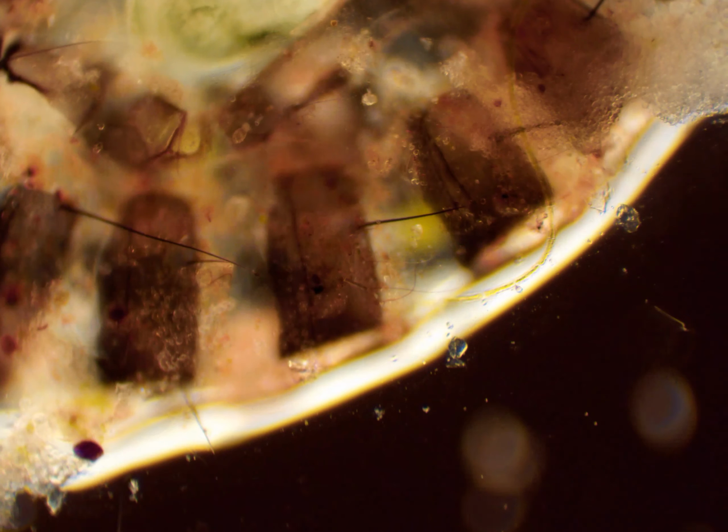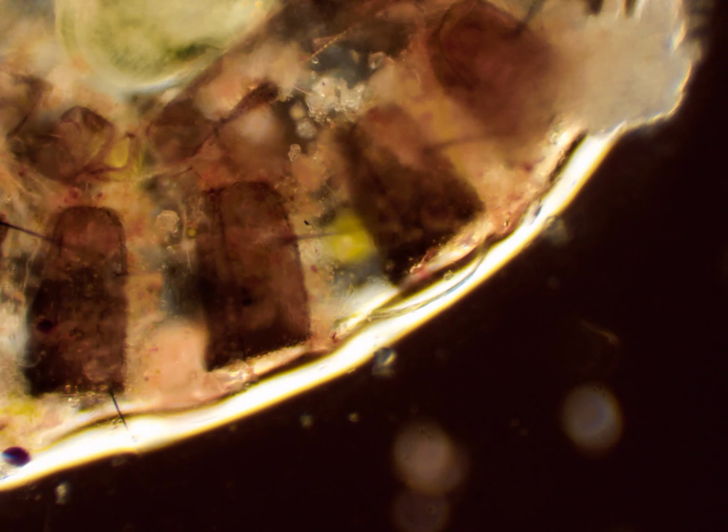So right there is an ostracod, and it is surrounded by something. What it is surrounded by is actually a mosquito larva. I found this floating on the top of one of my samples. And in it, you can see several different small rotifers, probably from the class Monogononta, feeding off of the insides of it. There's also Paramecium bursaria there.